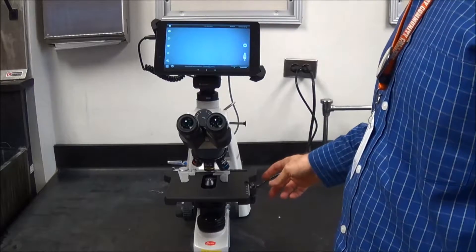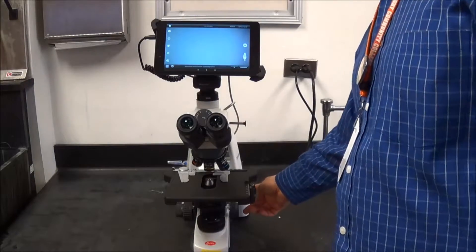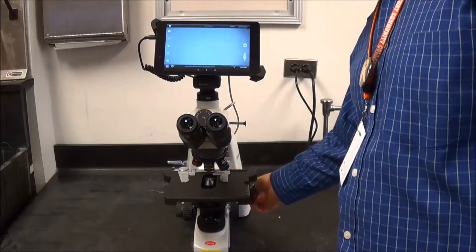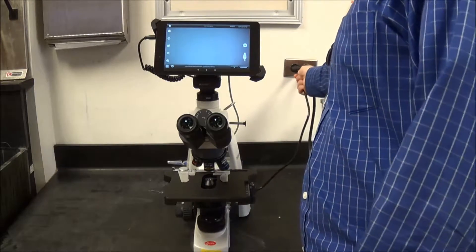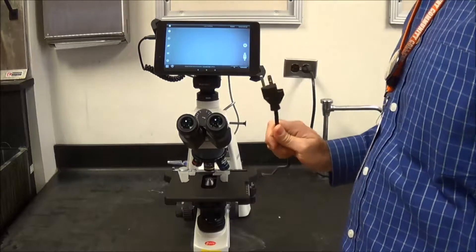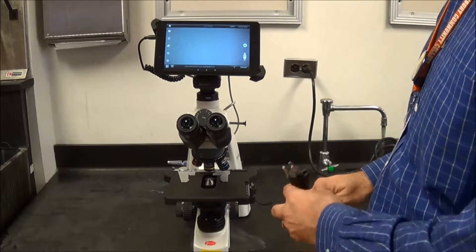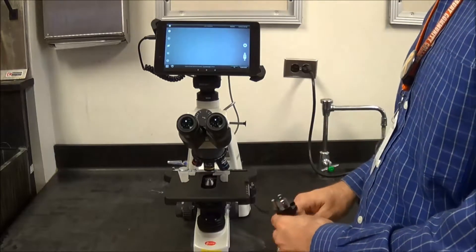In addition, you want to tell your students to turn the microscope off at the base. They would flip off the microscope, unplug it. There's only one plug for the microscope because the tablets are actually being powered through the microscope.